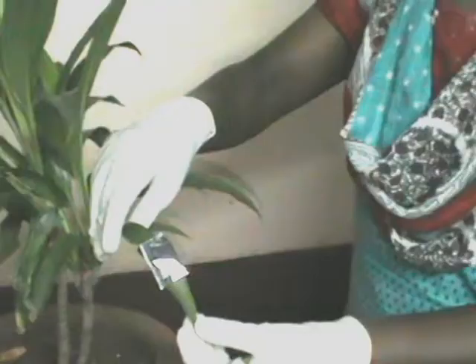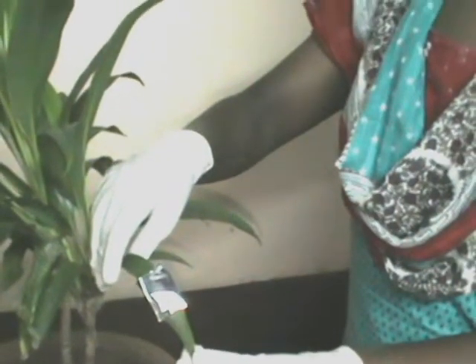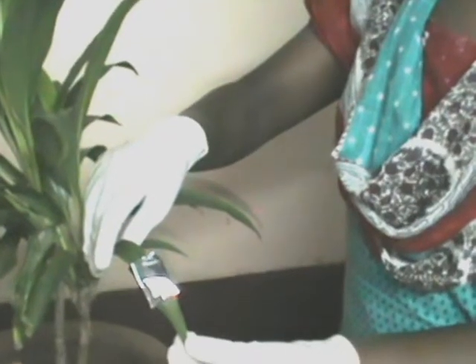This is a demonstration to show that sunlight is required for photosynthesis. Take a potted plant which is green and keep it in the dark for three days. The plant is then removed from darkness and one of the leaves is half covered with aluminium foil. After covering the leaf with aluminium foil, place the plant in the sunlight.